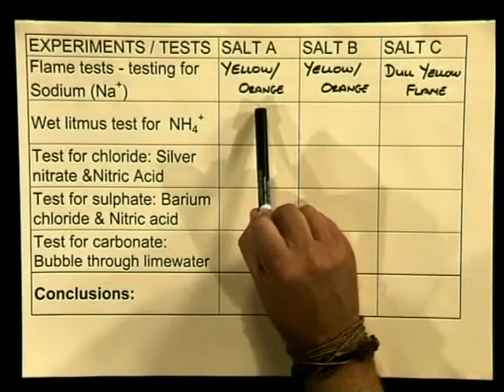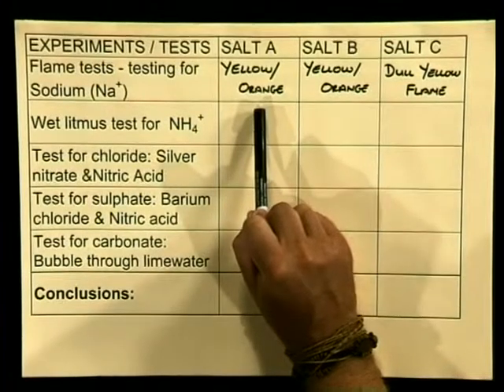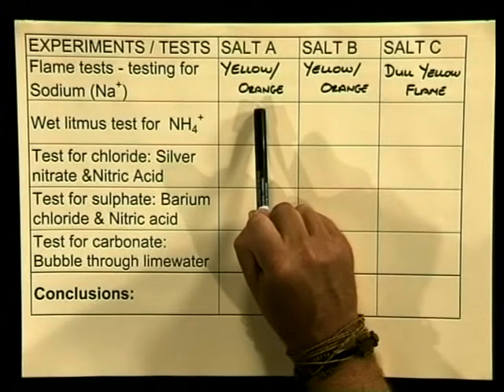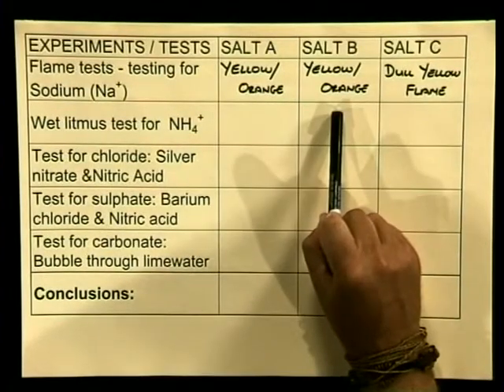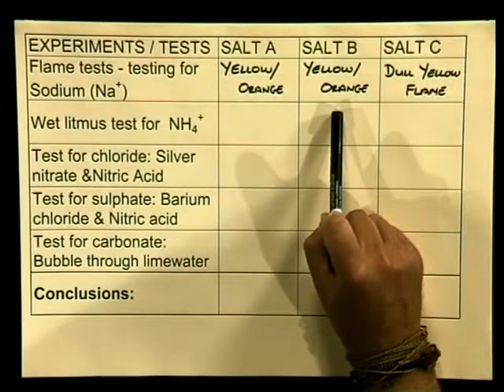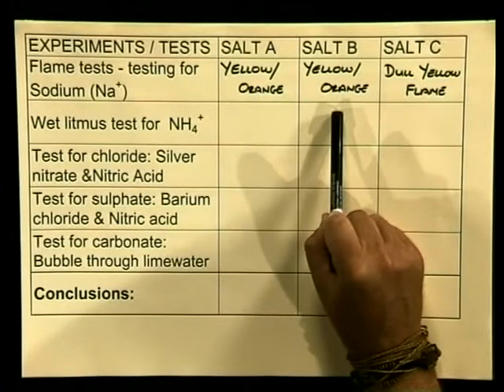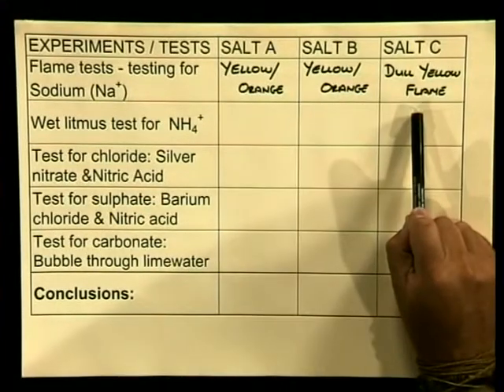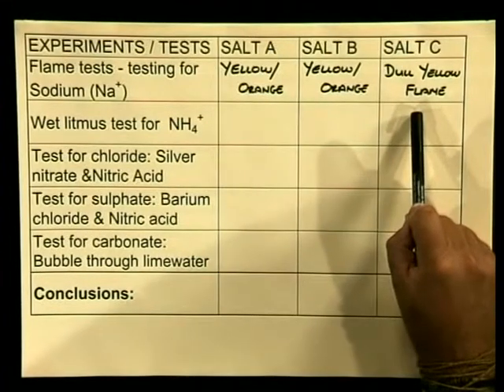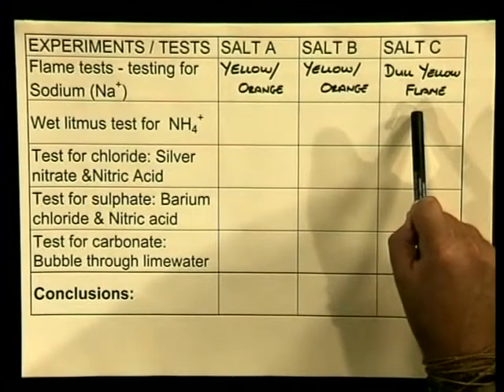Salt A gave us a yellow-orange flame — it may be sodium. We need to make sure it is not ammonium before we can be absolutely sure. The test on salt B also shows a yellow-orange flame; like salt A, it may be sodium but we would have to test for ammonium before we can be absolutely sure. The test result for salt C is a dull yellow flame, not nearly as bright as for A and B. This could indicate that salt C is an ammonium salt.